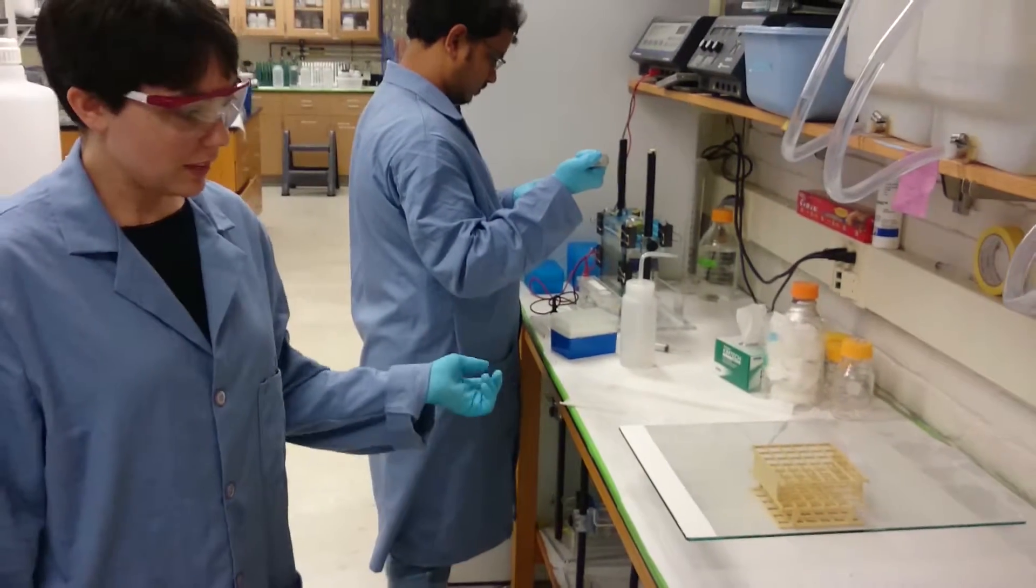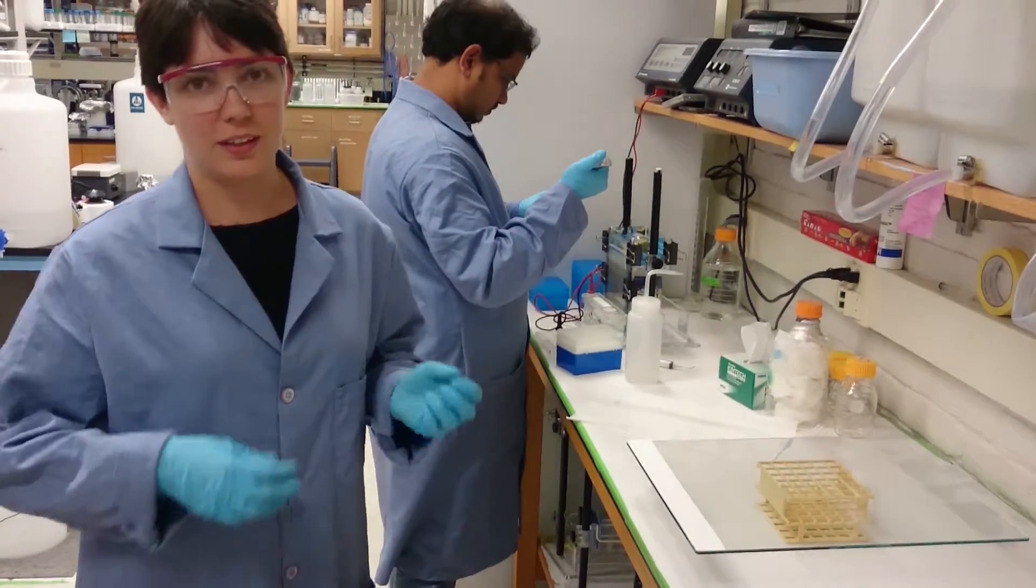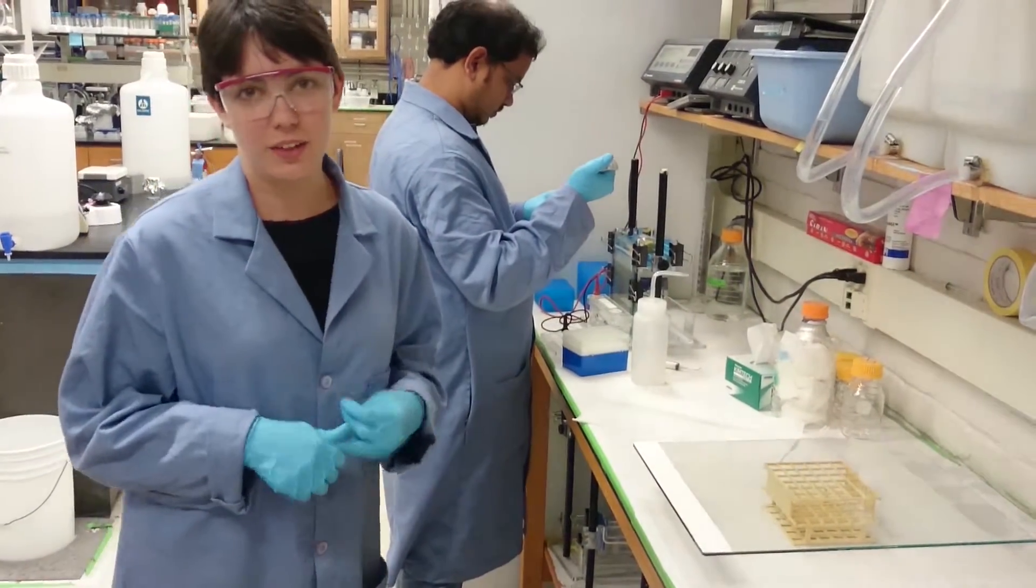Okay, so I've cleaned off both of these gel plates with water, then ethanol, and then water again.